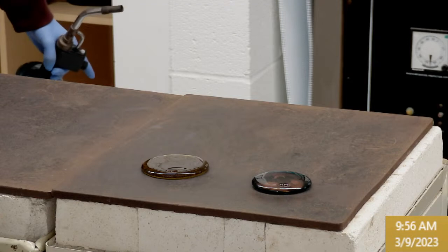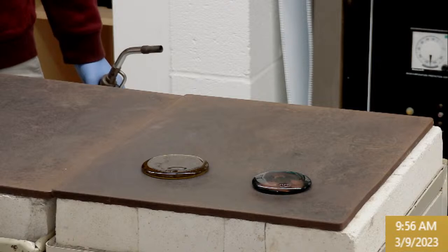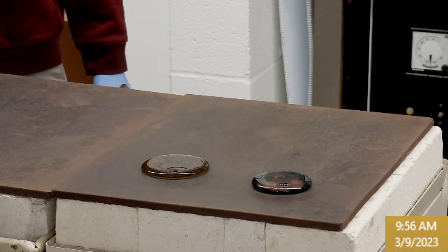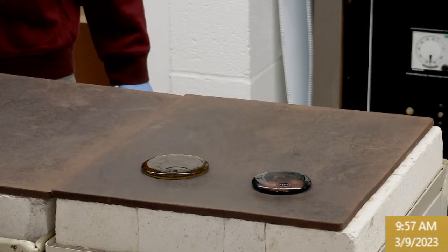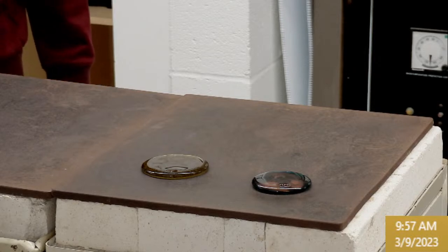Yes, you'll also hear what's called crazing. So crazing is when there's a differential rate of thermal expansion. The ceramic shrinks at a different rate than the glass. At the beginning, the glass is flexible and it's able to shrink and compensate, but eventually the glass hardens to the point that it can't move anymore, and so then all it can do is break. And so as the crucible and the glass shrink at different rates, you'll see little cracks that will form, and you'll actually see every time you hear something, a microscopic crack just zips across and eventually makes a crackle pattern all through the glass. Yeah, I can see them right now too.